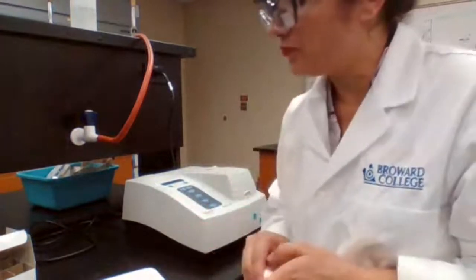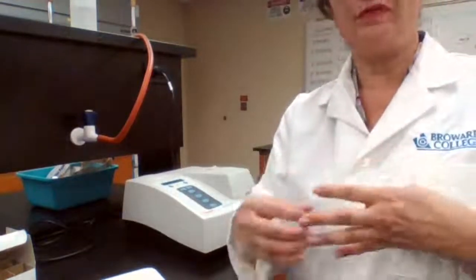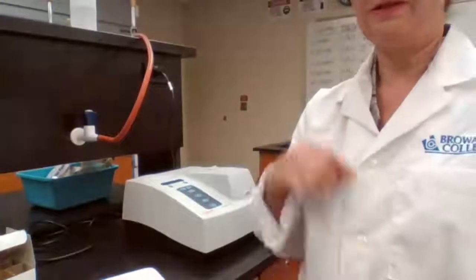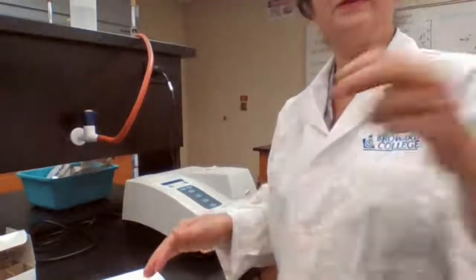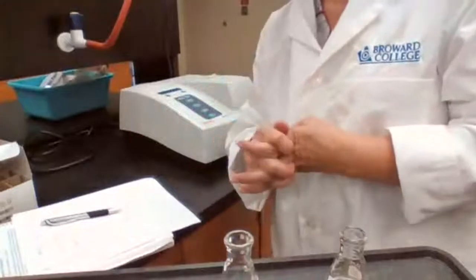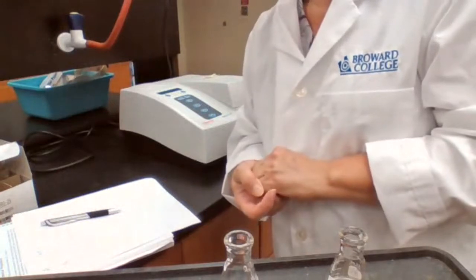I have my solution for C also set up at 2 o'clock. I have to wait for 2:05. I can test my solution B meanwhile. This is just being more efficient. I could have just stayed with the B, finished 5 minutes, and then started with the C, waited 5 minutes. But this way, if I can keep track of my numbers and the waiting time, I can manage to. I have 2 more minutes.